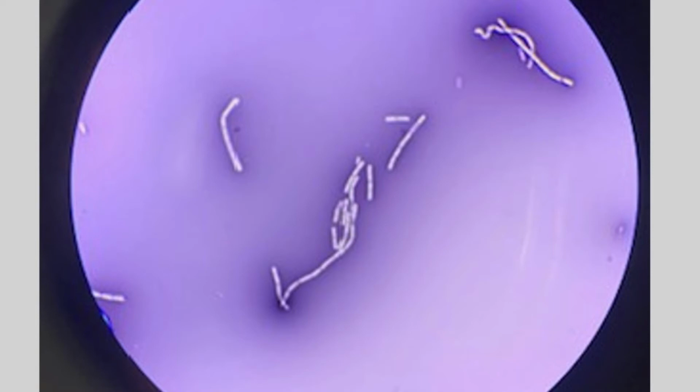Here's what our negative stain looks like under the microscope, and this is at 100x with the oil. As you can see, the bacterial cells are translucent, and the background is that purple color that I was telling you about. That is the anionic dye that has been spread very, very thin and reacts with the glass. So you can see size, shape, and arrangement of these bacteria. These are rather large bacilli, and they are forming these nice, long, beautiful chains. It looks a little bit different than what we would look at if we were using a cationic dye, but this negative stain gives us the ability to look at bacteria that might have a capsule.